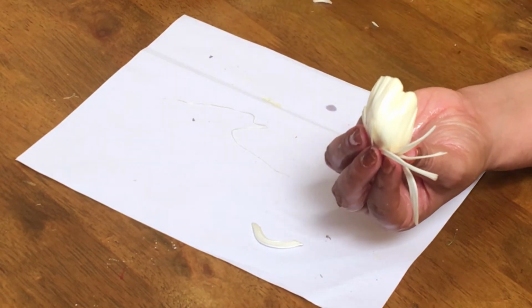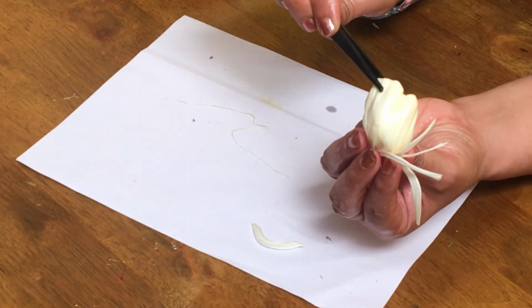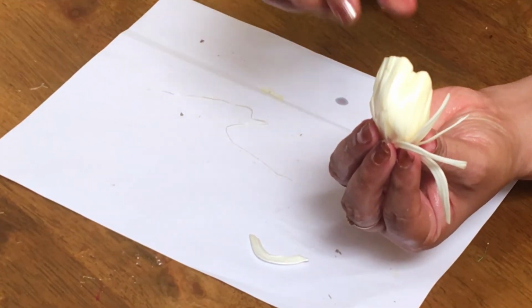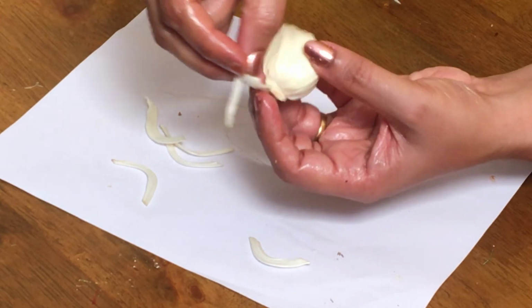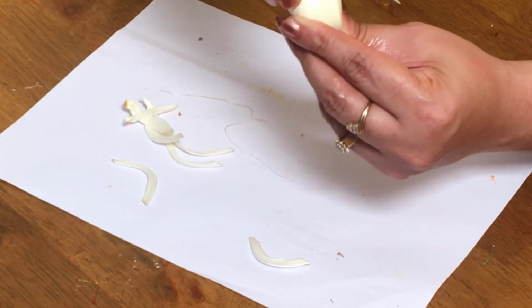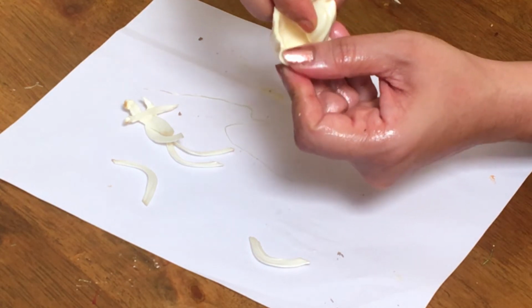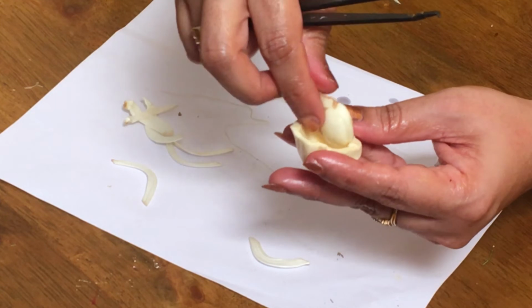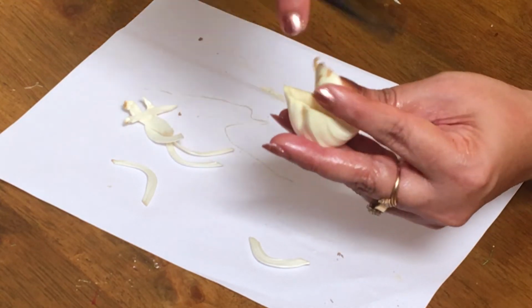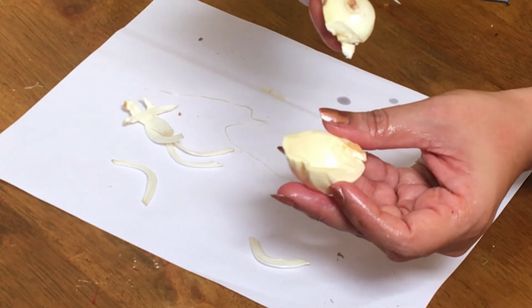Now the sepal and the petal of the flower have fused together to form a thick perianth, and this perianth is the one which we are eating. So I'll remove these bracts. The bracts are removed, and this is the perianth which is fleshy. Now if I open the perianth, we will be able to see a fruit inside. So this is a fruit. Now which is a fruit? This thin, skinny, leathery part which you can see is a fruit. See, I've taken out the fruit.